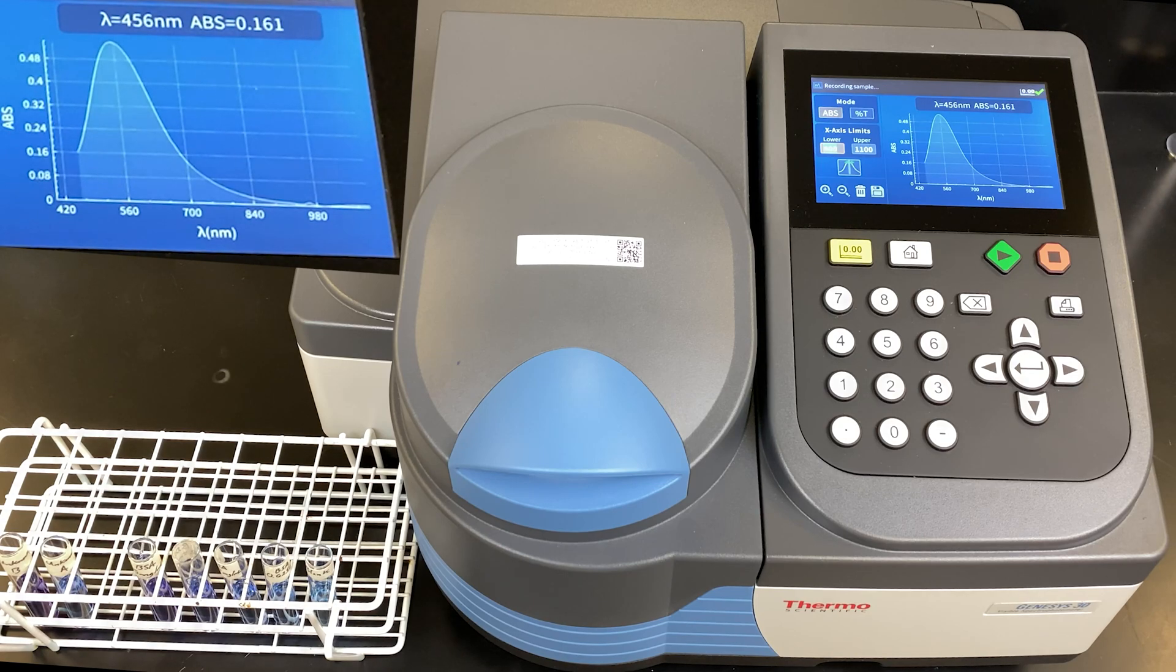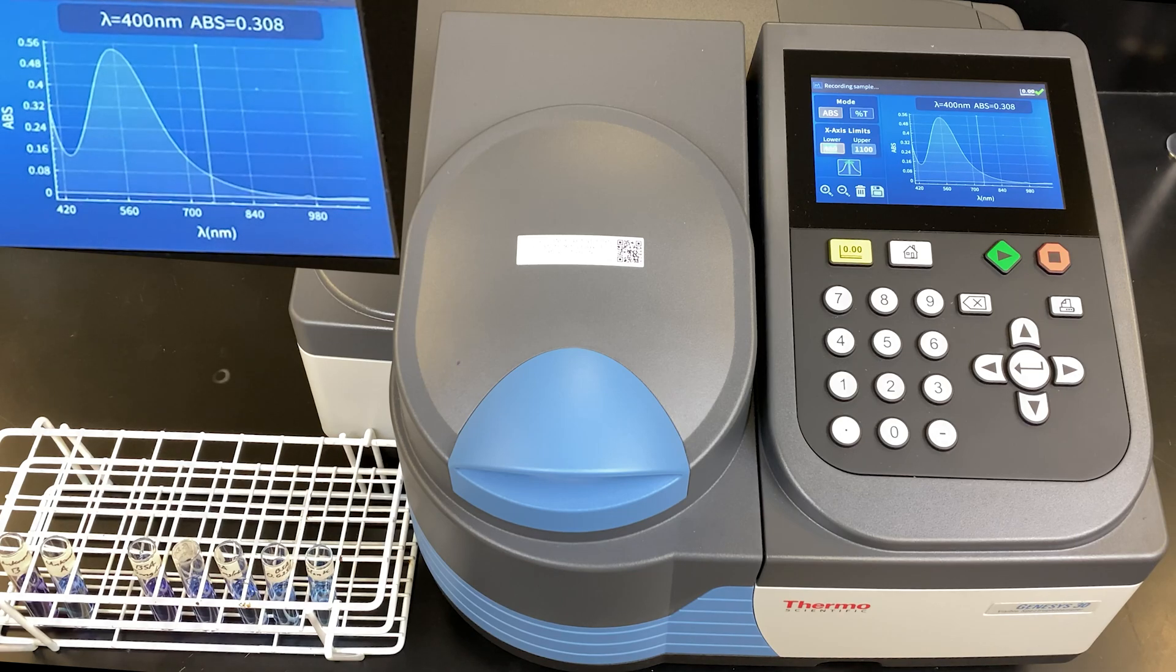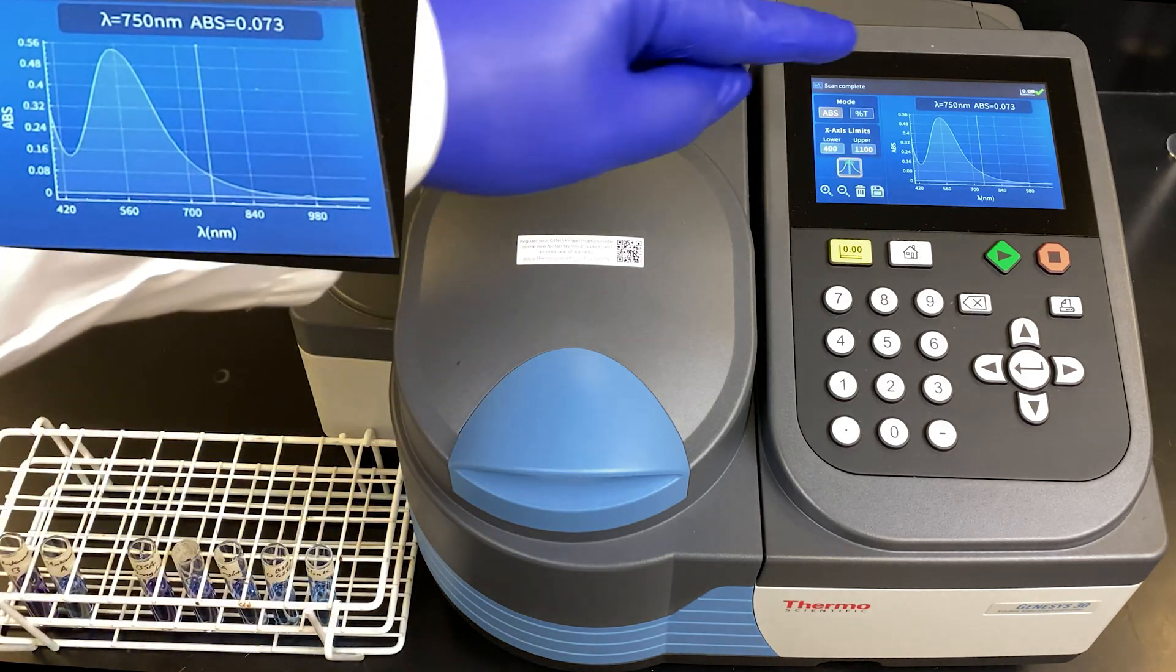Dropping down. And then it looks like it's leveling off again. A little spike there at the end. Once complete, the data remains on the screen.